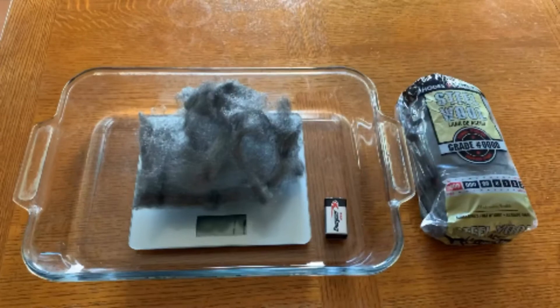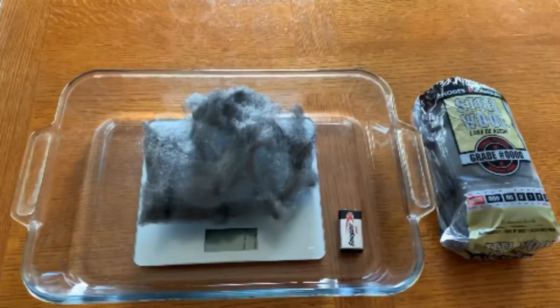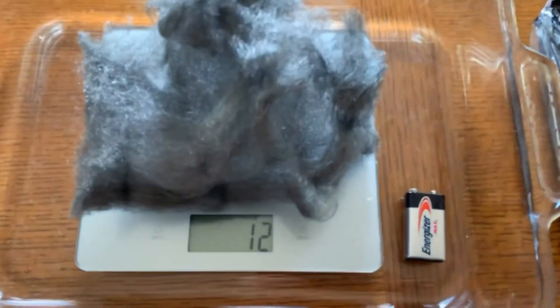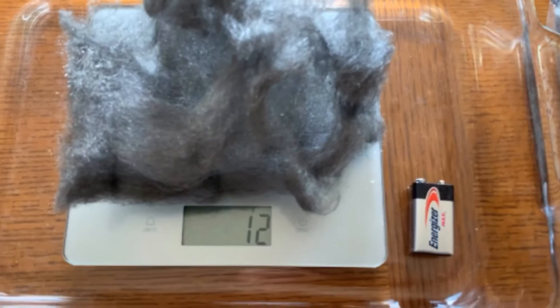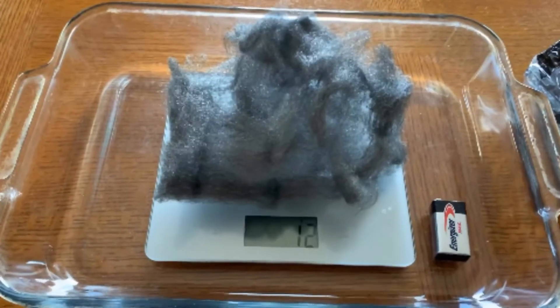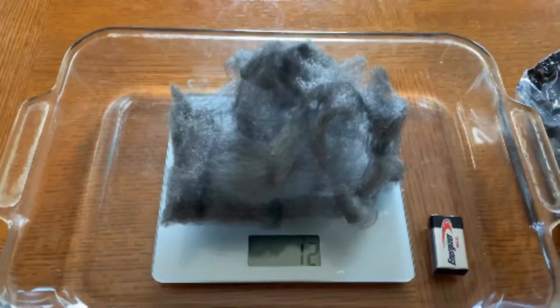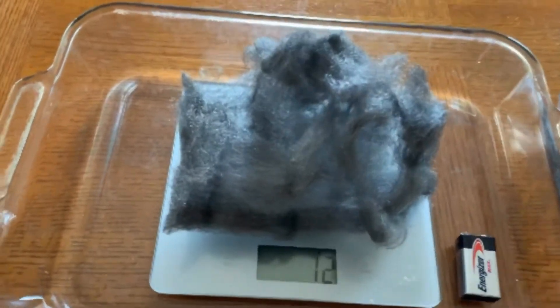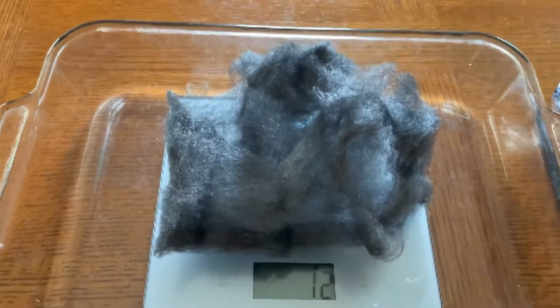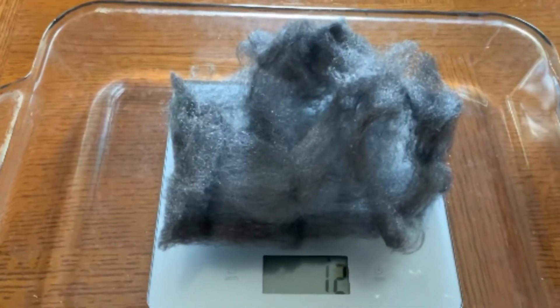Welcome back to Ramseyland. Today we're going to perform a redox reaction with steel wool, a scale, and a 9-volt battery. The essential question in this lab is: why does the steel wool gain mass during combustion?